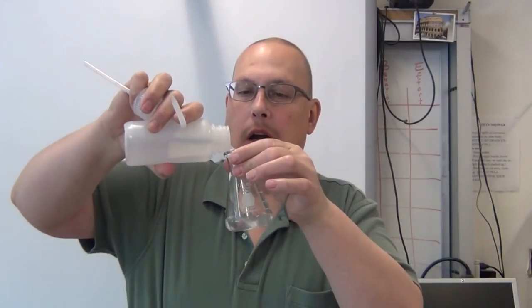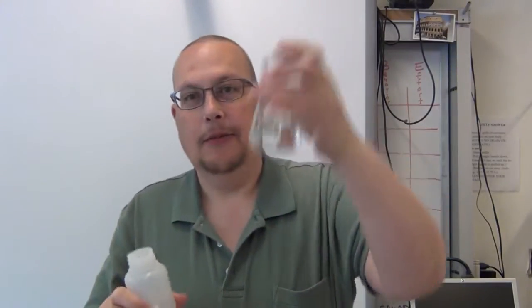How do you know? Let's find out. I'm going to take this distilled water and put some of it into this flask right here like that. Let's just open this up and pour this in like that. Isn't that delightful?